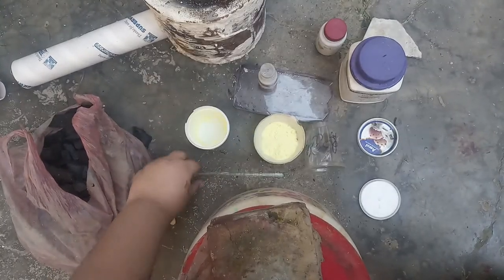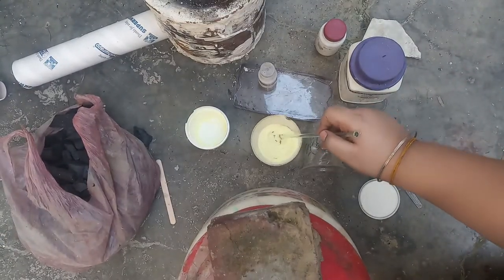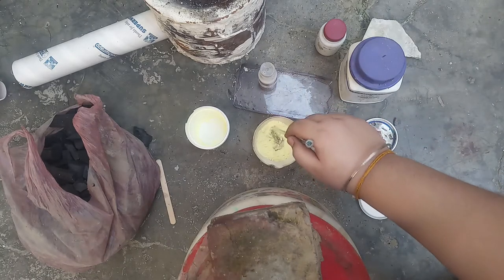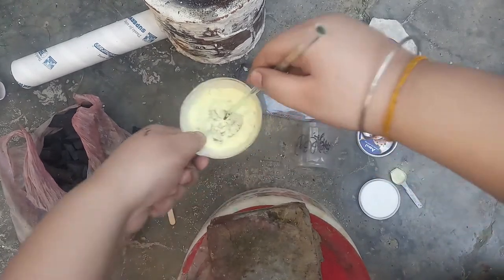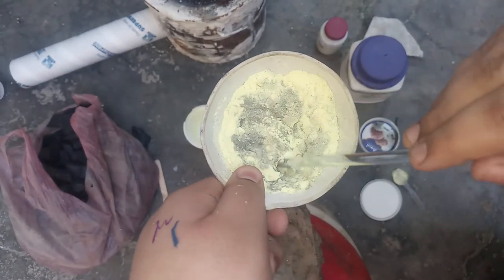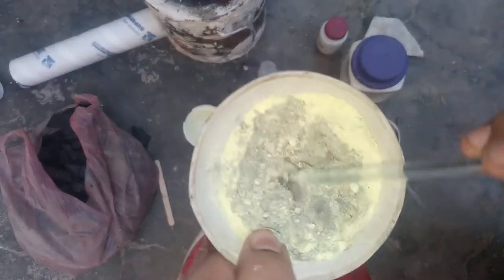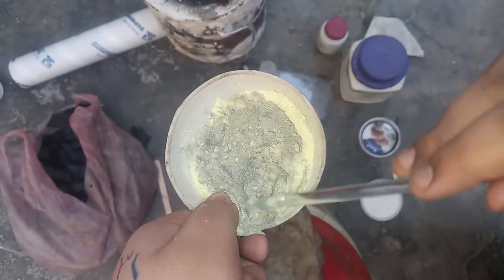This has to be extra pure — some use the flower sulfur, the garden kind. We have to break all the clumps and mix it thoroughly. All clumps must be destroyed. We have to use stoichiometric amounts. Copper can be used as an impurity to make it glow in the dark.